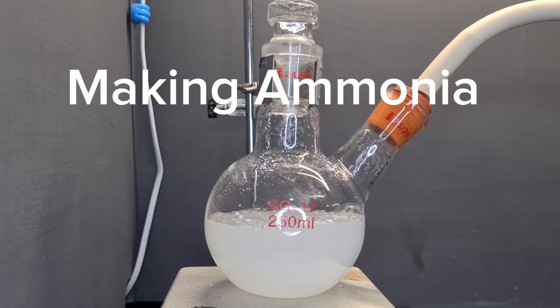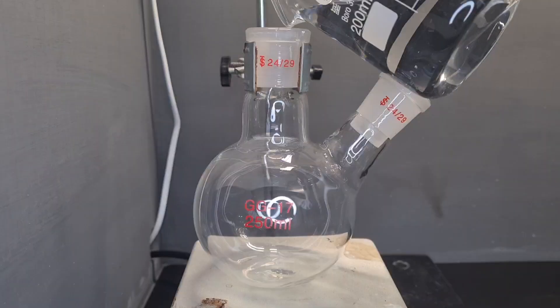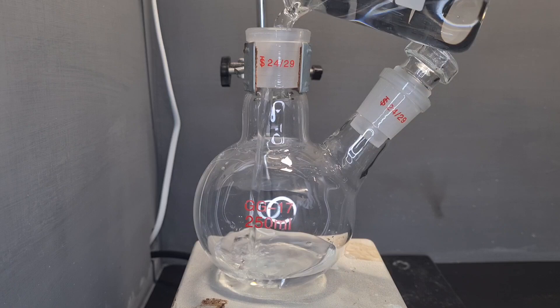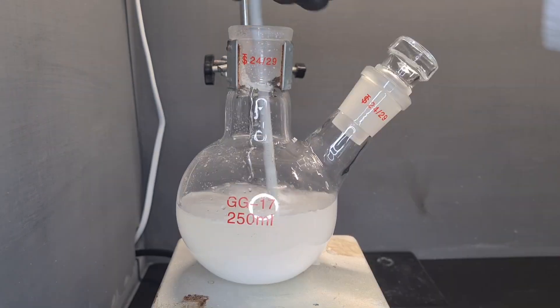Okay, so in today's video I'm going to be making concentrated ammonia and I have a really easy way for you to do it.